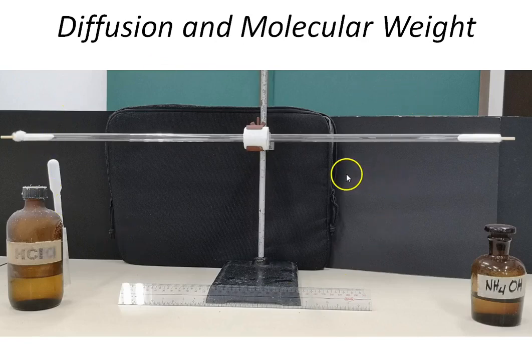As you can see, we have a clean glass tube clamped horizontally to an iron stand, and at the end of the tube you have cotton buds. In these cotton buds, we will be adding simultaneously approximately 10 drops of 1 molar HCl on this side, and 10 drops of ammonium hydroxide on this side.